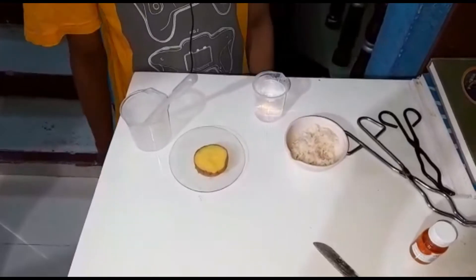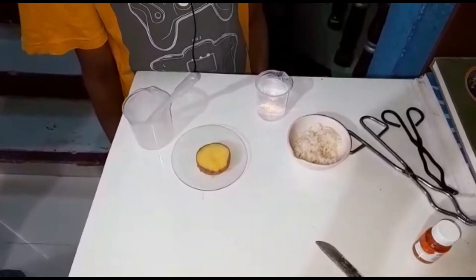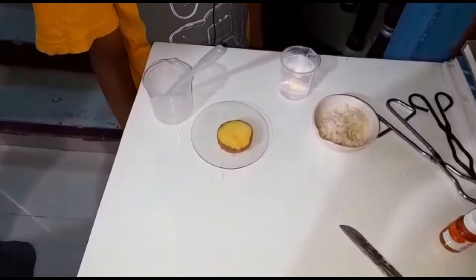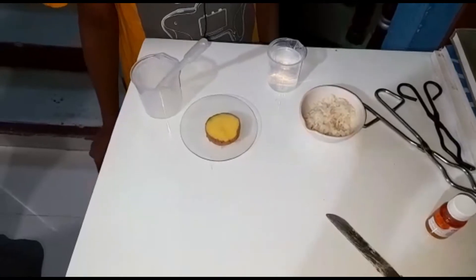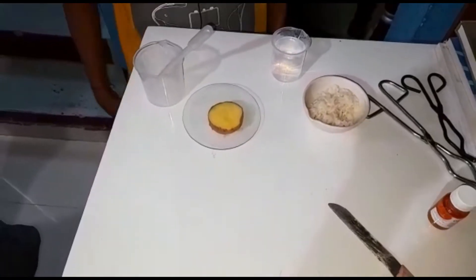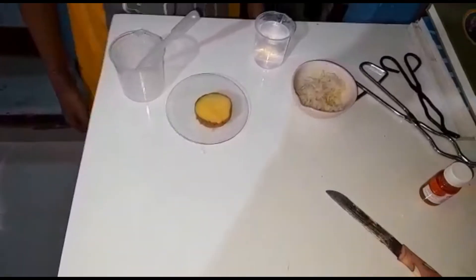In this video, these students are going to test the starch, and you will see the results. These students are going to perform components of food Activity 2.